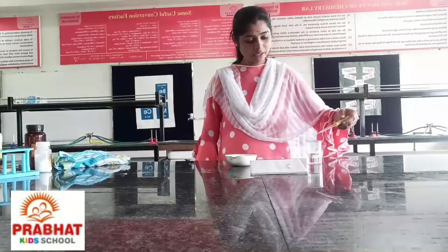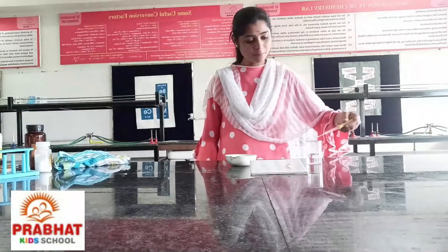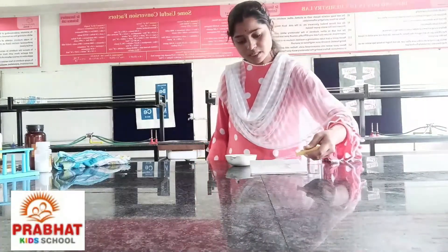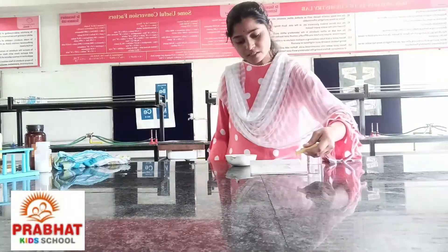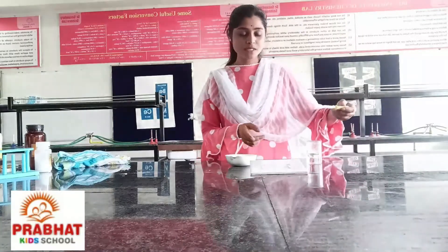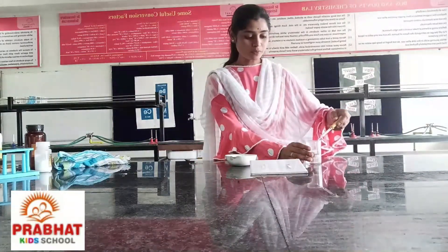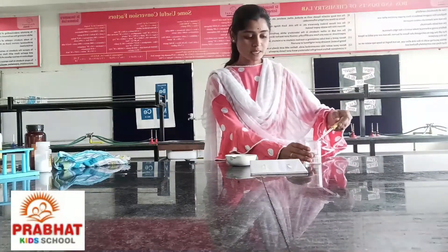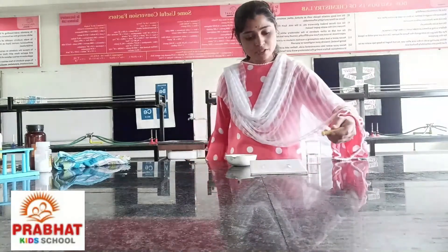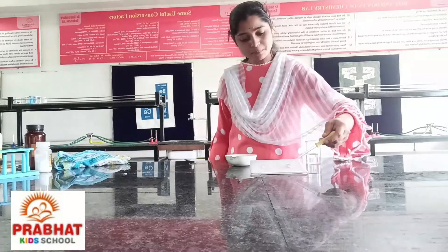I have taken this unknown sample in the dropper and put it on the first red litmus paper. Observe it carefully. Now, the same unknown sample is put on the second blue litmus paper.